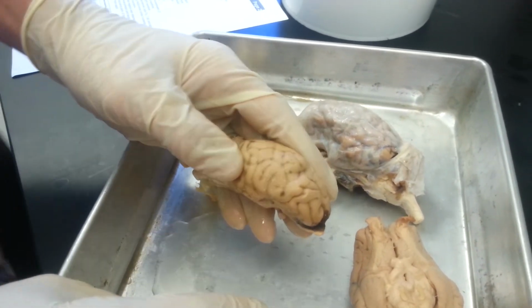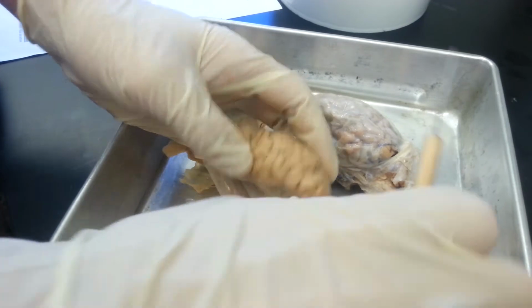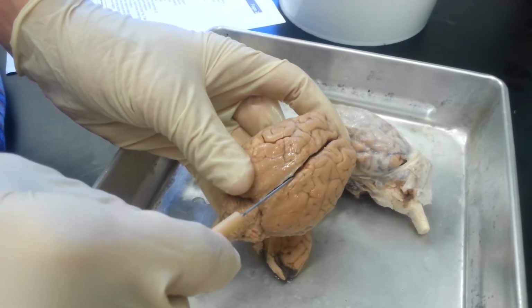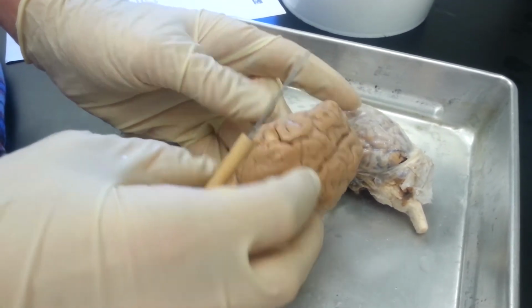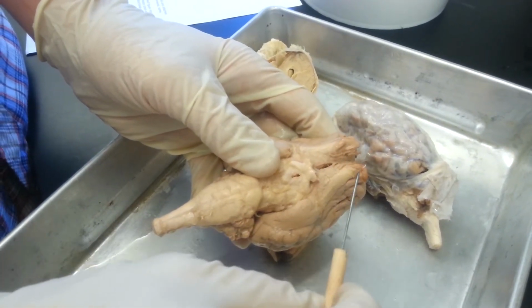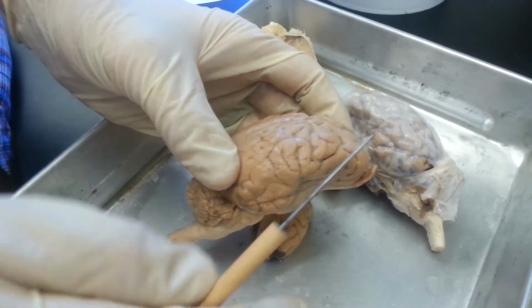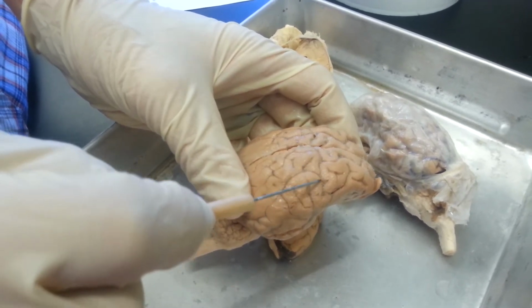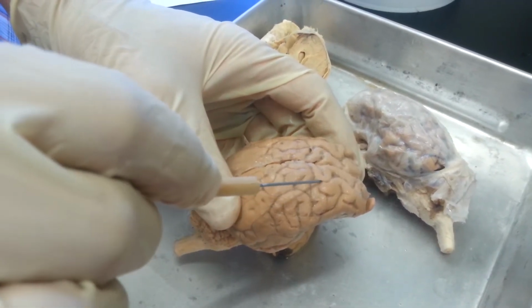the order of them. The large lobe in the front that's very folded is your cerebrum, and it is split into two cerebral hemispheres and separated by the longitudinal cerebral fissure. Then you have two lobes which control the olfactory region. These are the olfactory bulbs. And then on the cerebrum you have folds and valleys. The folds, the raised portions, are the gyri, and the wrinkles are the sulci.